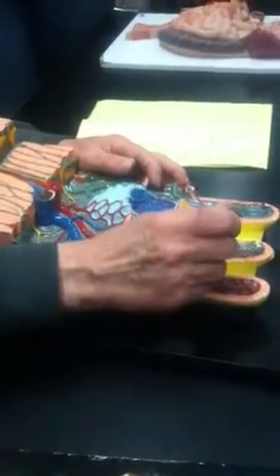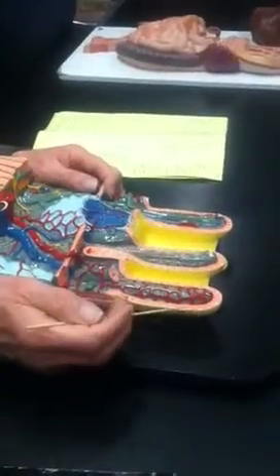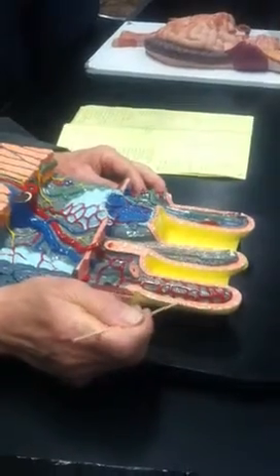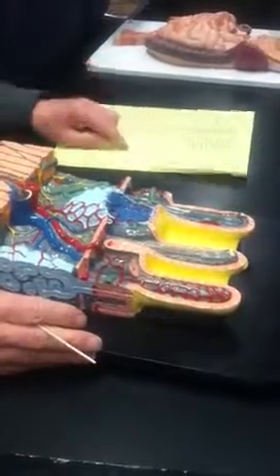All the little blue spots that you see here are mucus-secreting cells. They are generally known as goblet cells, because under the microscope they look like a wine glass. So if I point at these little blue things, you have to tell me goblet cells. If I point to the whole thing, with multiple arrows, it's a villus. Multiple for villus is villi.